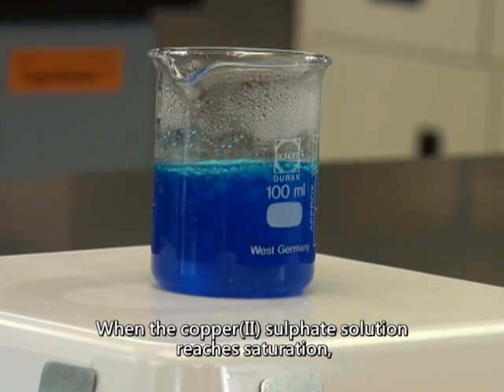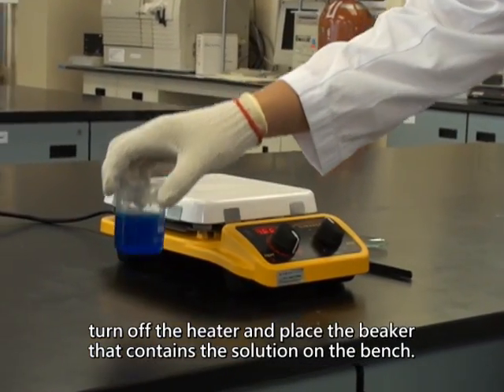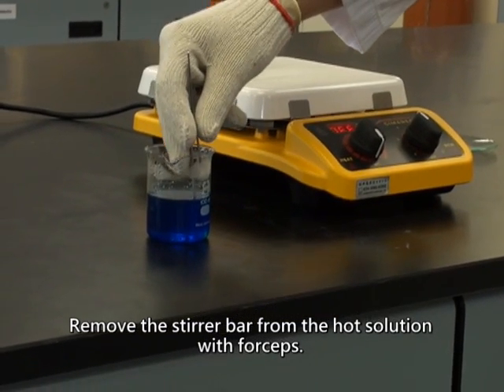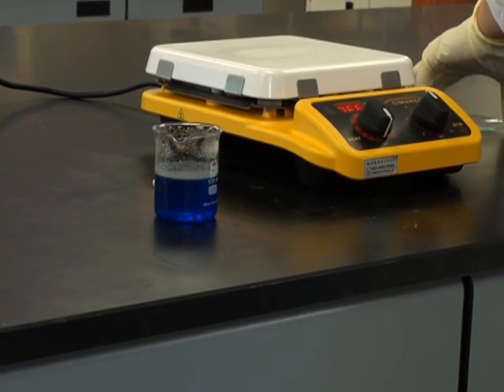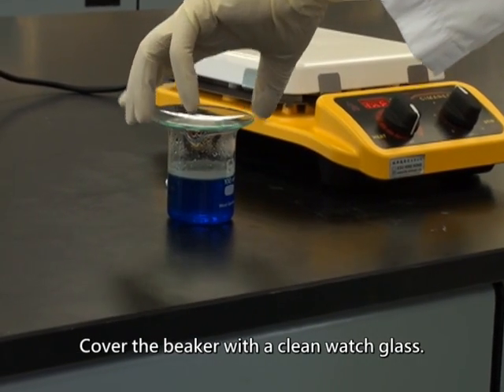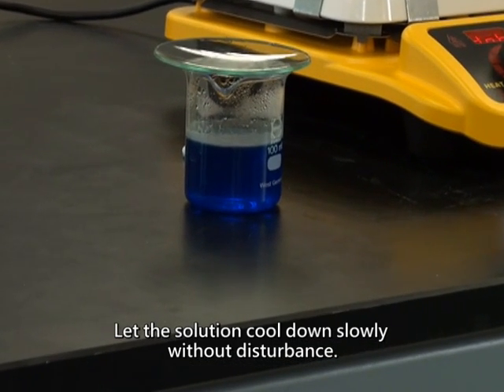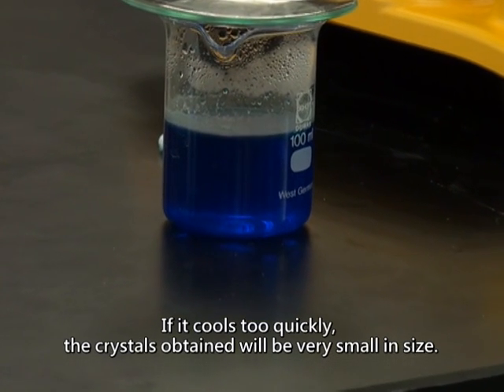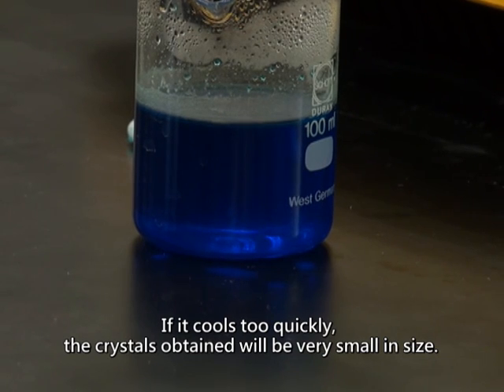When the copper-2 sulfate solution reaches saturation, turn off the heater and place the beaker that contains the solution on the bench. Remove the stirrer bar from the hot solution with forceps. Cover the beaker with a clean watch glass. Let the solution cool down slowly without disturbance. If it cools too quickly, the crystals obtained will be very small in size.